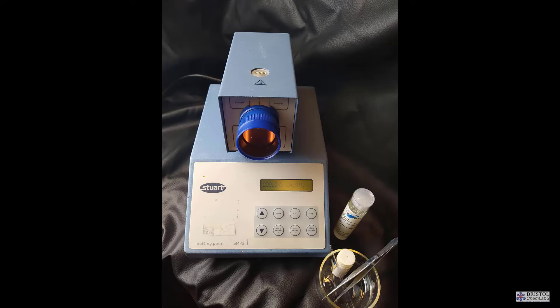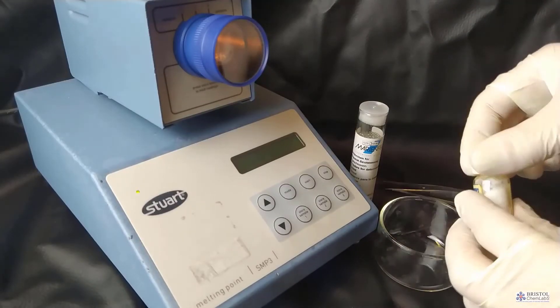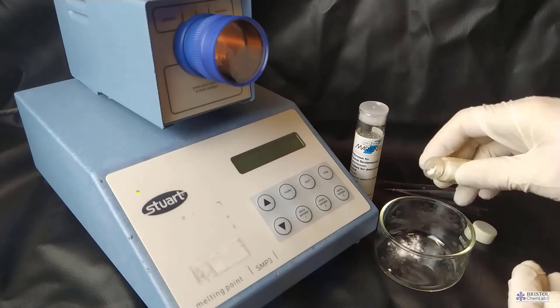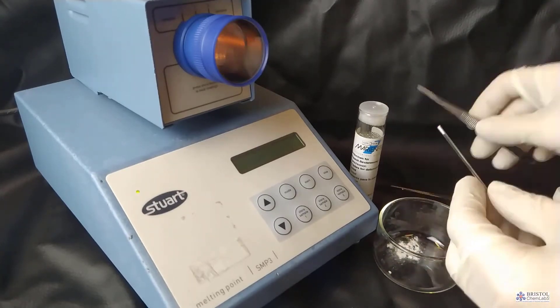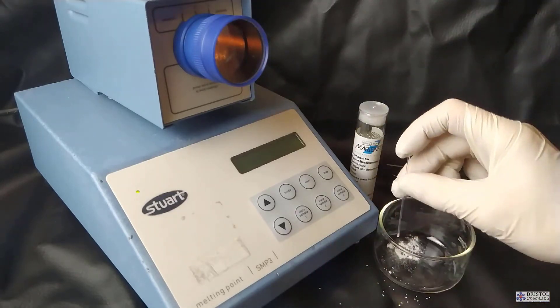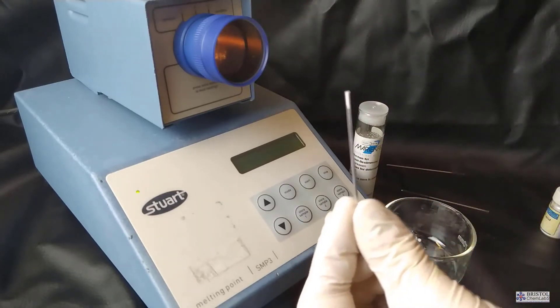There are many different types of melting point apparatus but they all are essentially a heating mantle to which a thermometer is attached. This may be a thermocouple in the case of a digital readout. The first step is to get some of the solid into a very thin capillary tube that's sealed at one end.